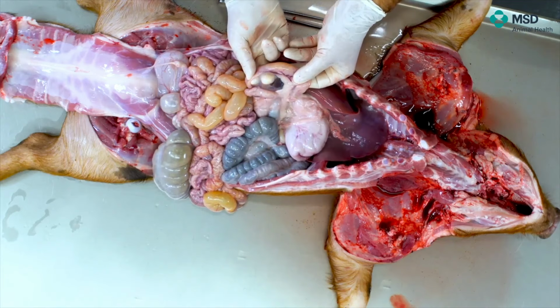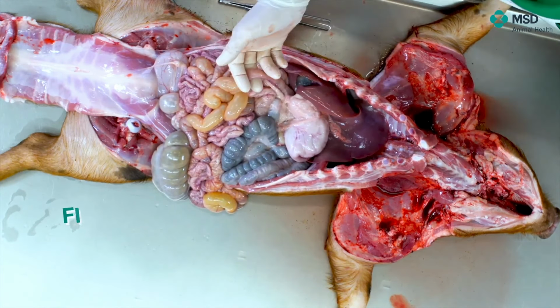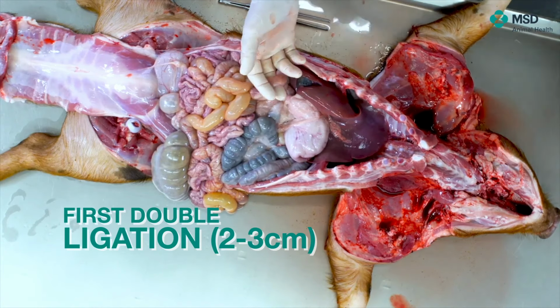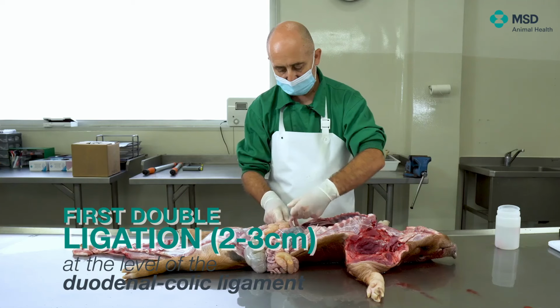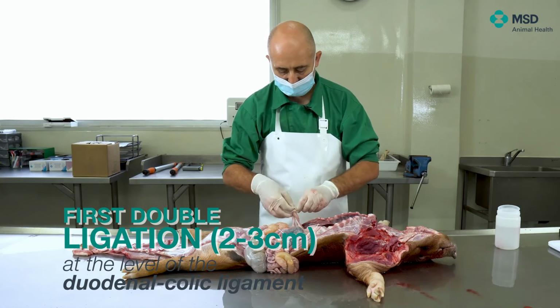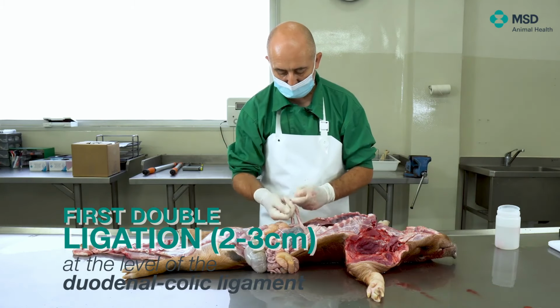So we have some strings, as I showed you before, and what we will do is to separate the loops by making a couple of knots separated in general terms by 2 centimeters because we will cut in between.